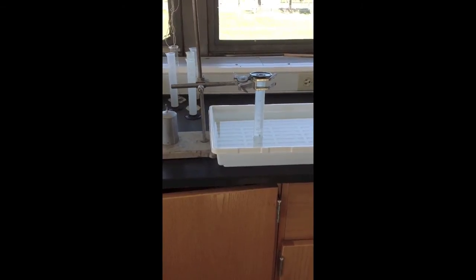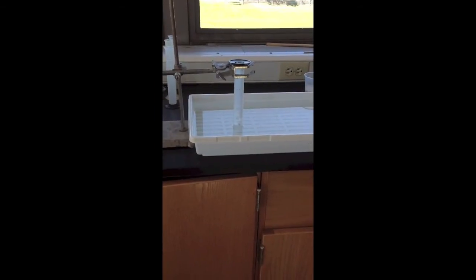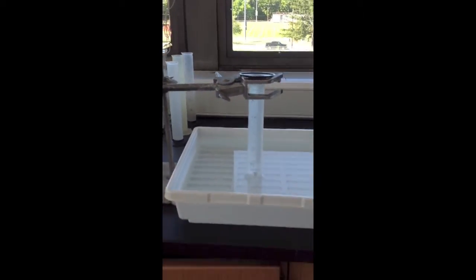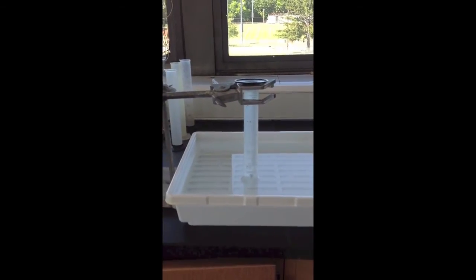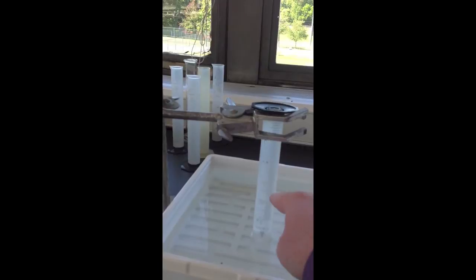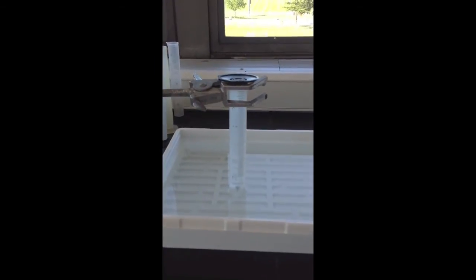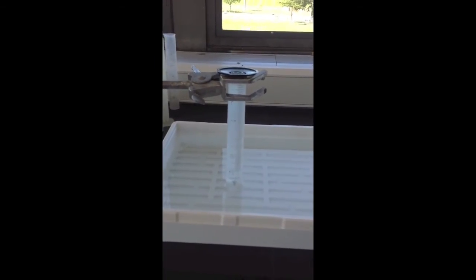All right, here's how we're going to measure it. We have a pan of water filled about halfway up, and we have a graduated cylinder. The graduated cylinder also is filled with water. You can see, if we could focus there without the light, we can see the level of water inside of the graduated cylinder. And the oxygen is going to displace that water. So, we could take readings of the volume of the airspace in the graduated cylinder, and as it goes lower and lower down the column, that means more and more oxygen is being produced by the reaction that's going into that cylinder. So, that's how we're going to measure it.